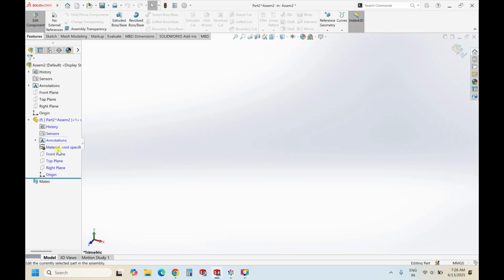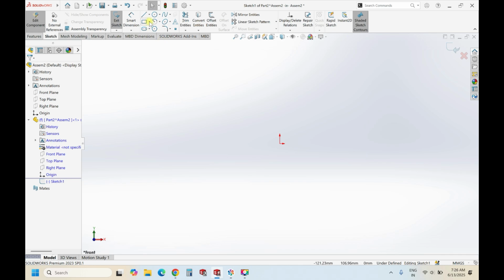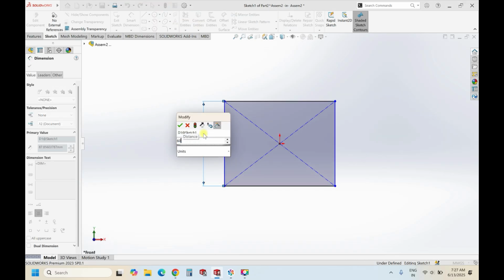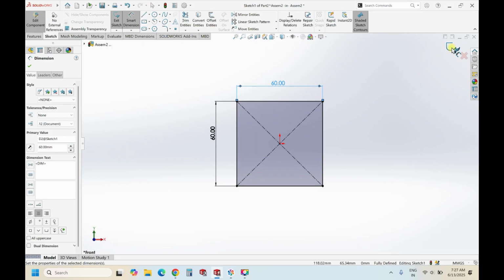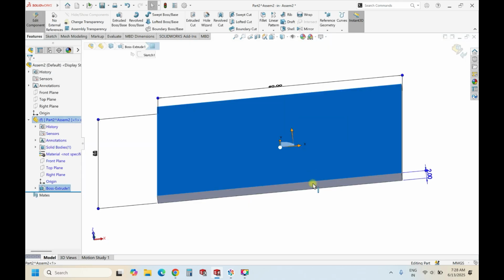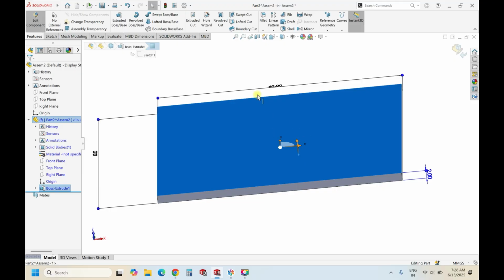Now in this part, let's select the top line, right? So let's keep a random dimension of the chip. Let's extrude this. Now we don't need that much, so we extrude it to 2 mm, that's it. This layer we consider for the top layer, second layer, and the underneath layer of this we will do for the third layer. Okay, so select this layer and make a sketch on this.